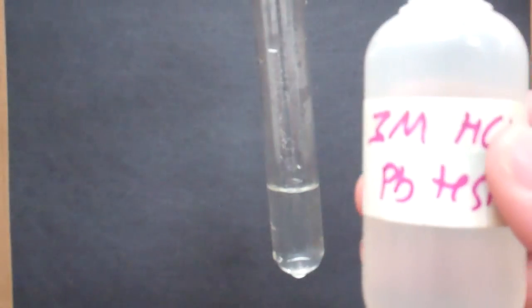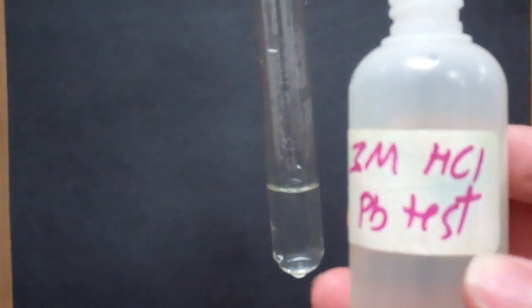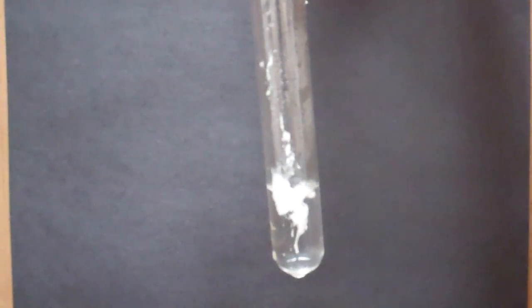That's the first part. The second part is that we need to add in 20 drops of our 3 molar HCL solution. So as we drop this in we should immediately start to see the reaction occur.